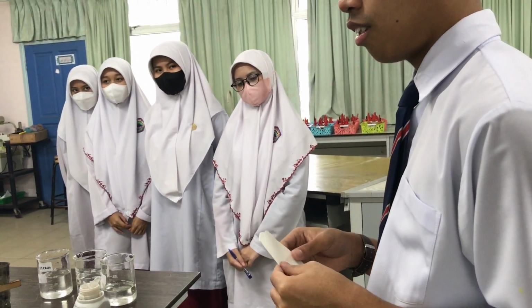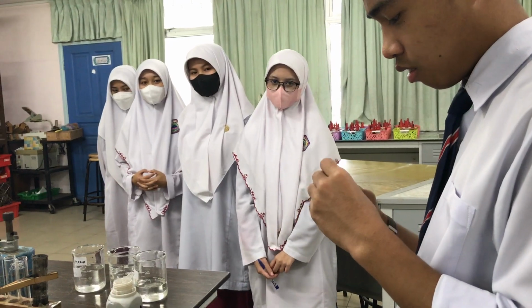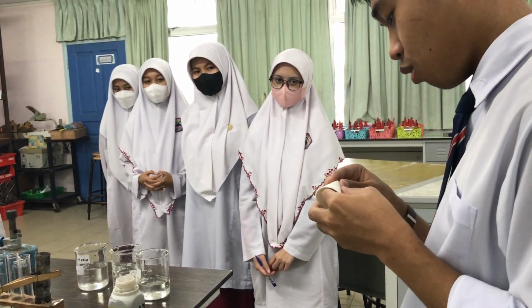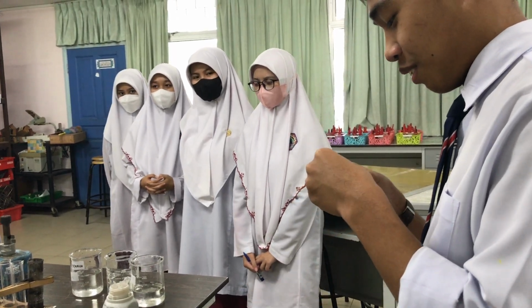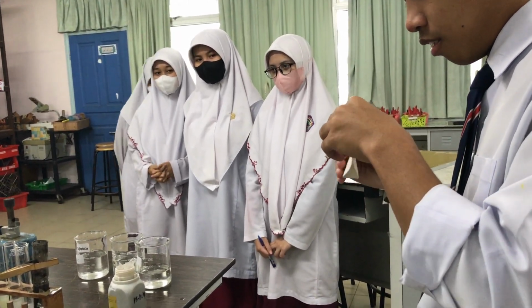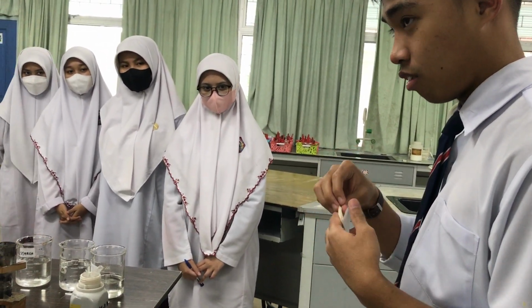What is the second step you're doing? Fold it again into half, okay? And then? Fold first. You said it right, fold first. And then you open it up, okay? Alright, and then what next? I don't know, show me.